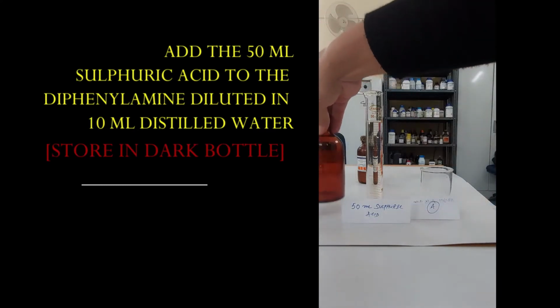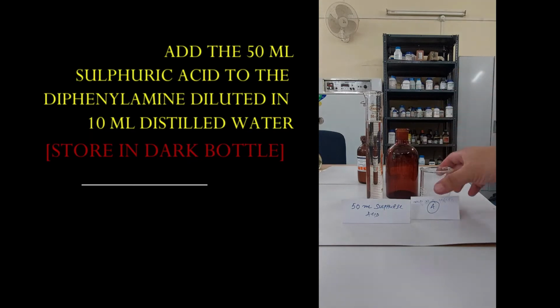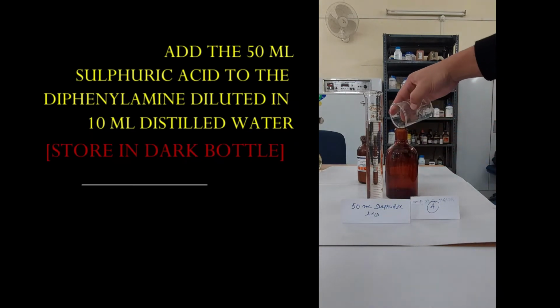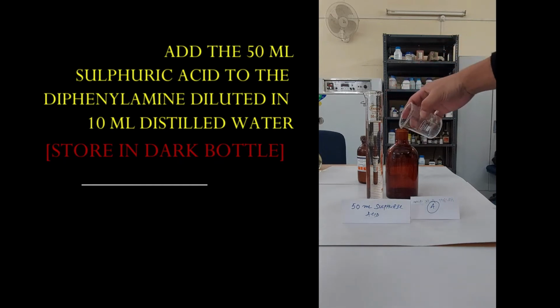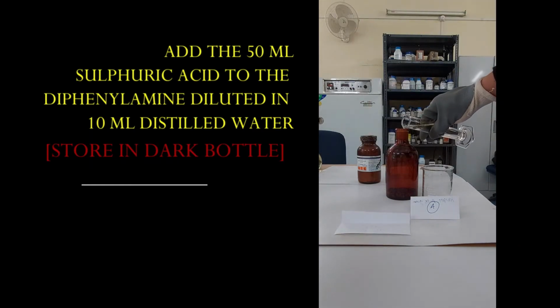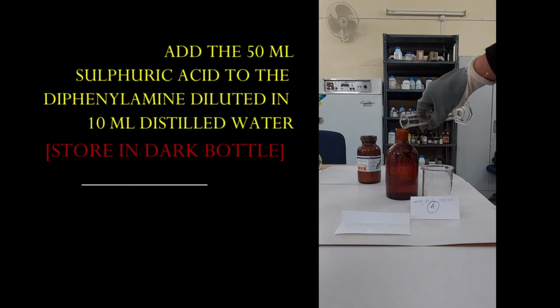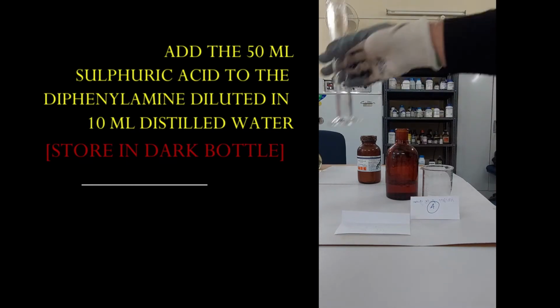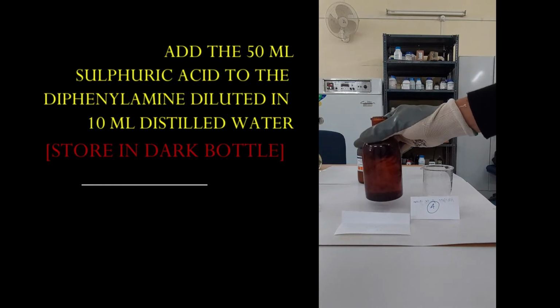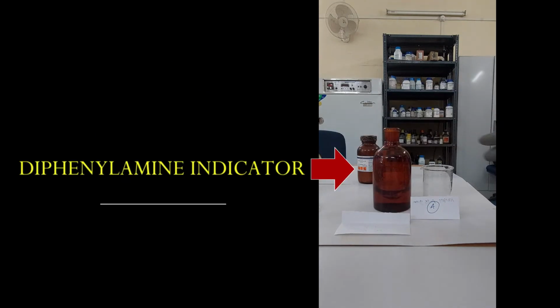And always remember to store this mixture in a dark bottle. Be cautious while pouring concentrated sulfuric acid. And this is a diphenylamine indicator.